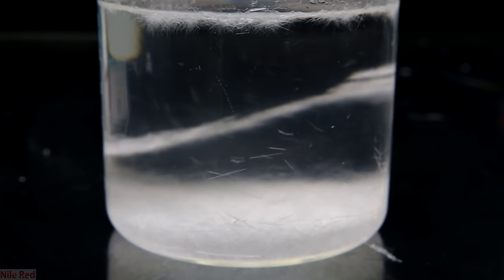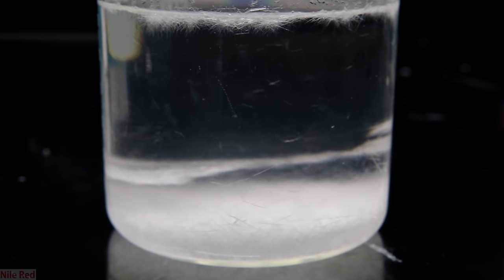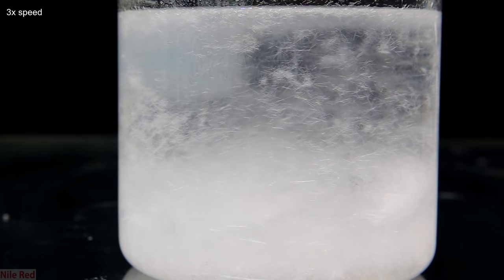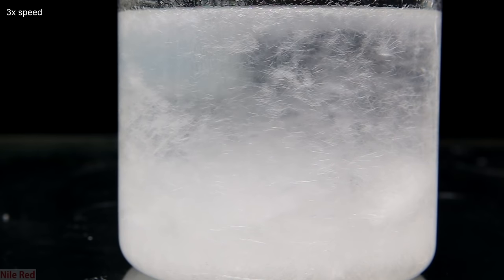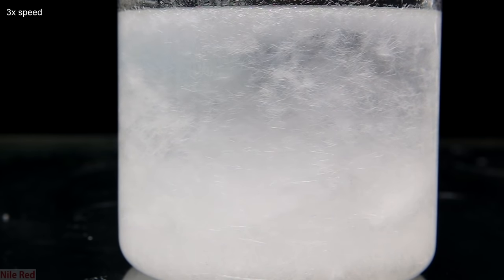After a while, a big piece of the crystals that had formed at the top fell to the bottom. When I come back a little while later, I see that there's a lot more crystals and it's slowly clouding over.